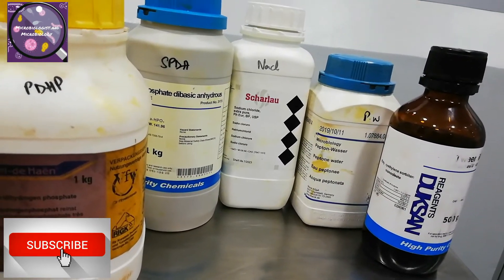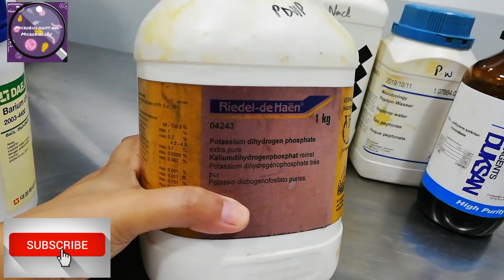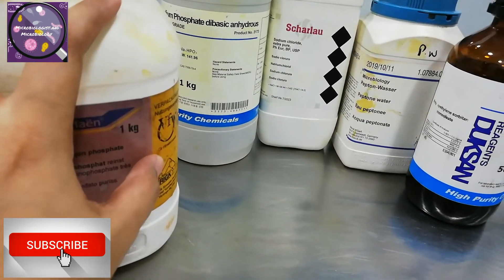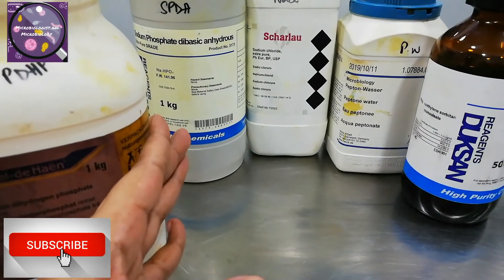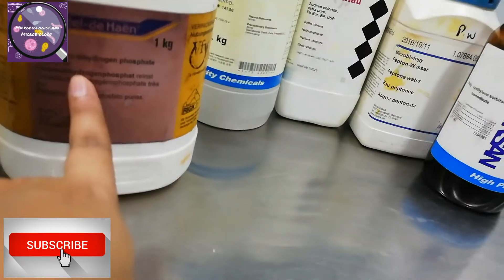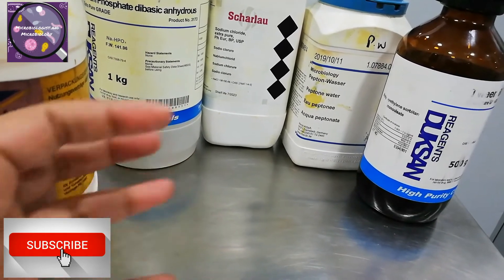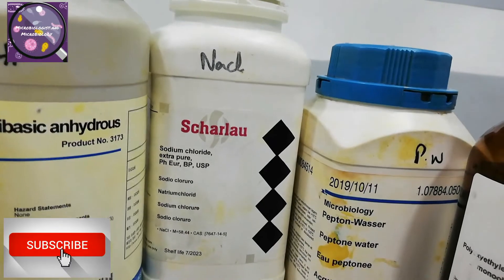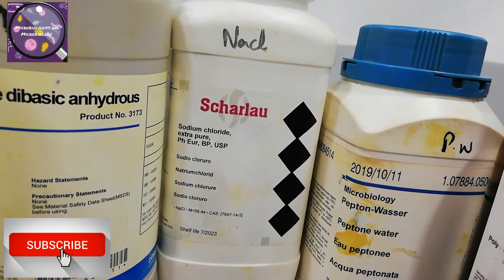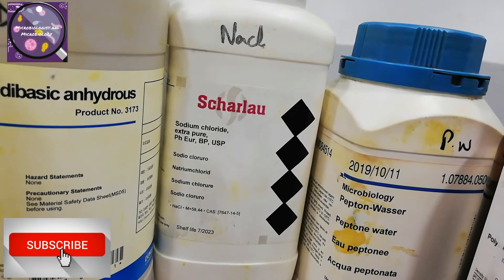These all members are used together for making one solution: buffer saline peptone water. Potassium dihydrogen phosphate is extra pure and provides electrolytes for organism growth. Another one is sodium phosphate dibasic anhydrous — it performs the same function but provides sodium instead of potassium. Sodium chloride is already discussed but also gives electrolytes and provides transport for organism cells. Peptone water has already been discussed.